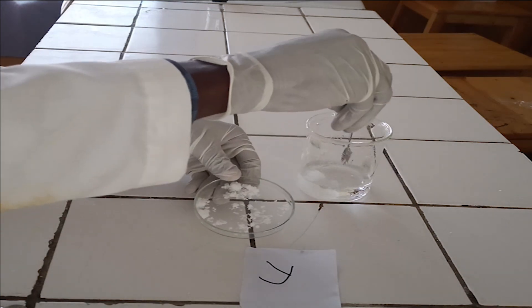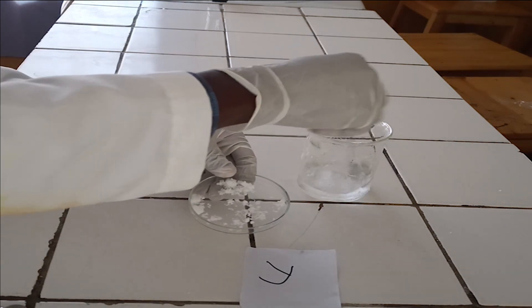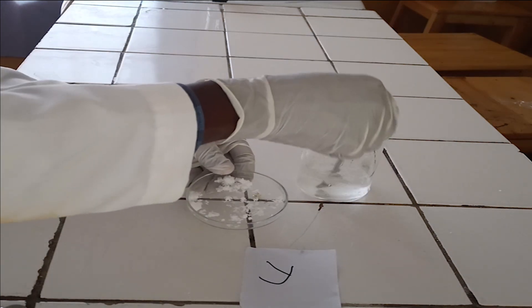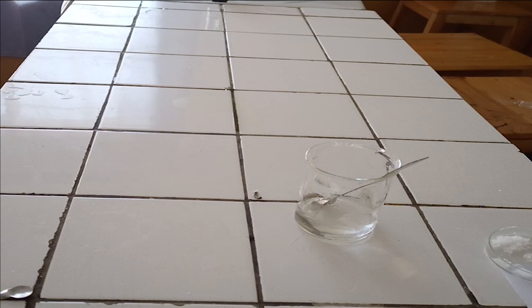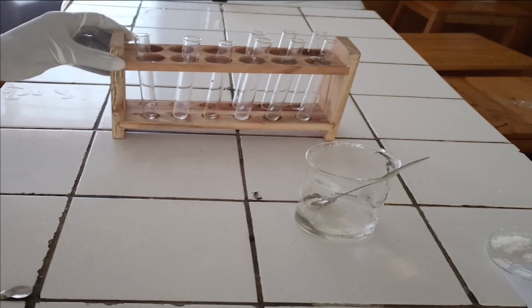Second step: dissolve one full spatula of salt in 50 milliliters of water. When salts of magnesium ion dissolve in water, they form a colorless solution.